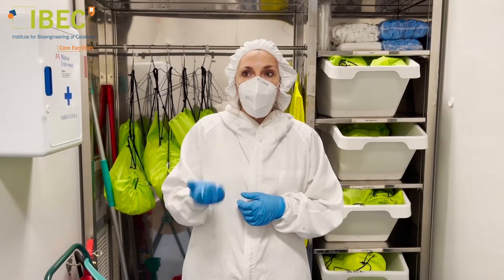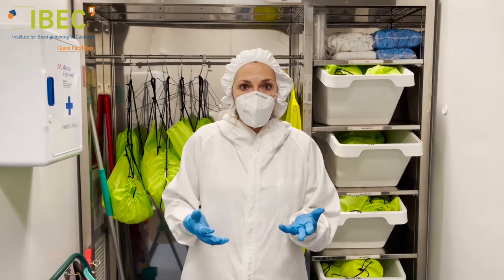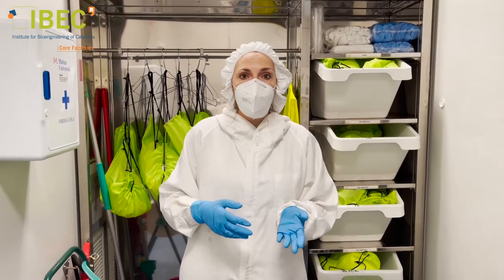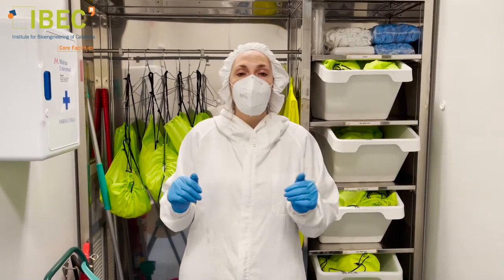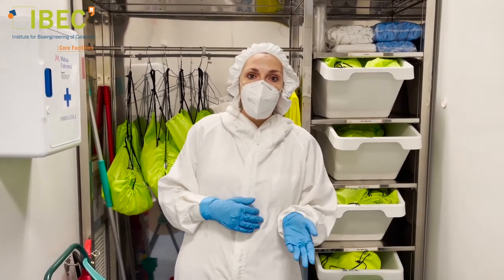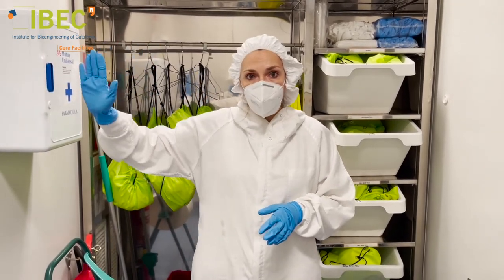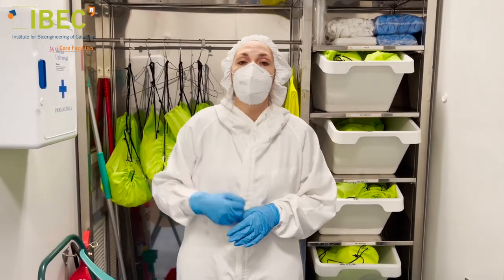Conditions such as temperature, humidity, and pressure are constantly monitored to assure uniformity of conditions during fabrication. For instance, the temperature is always kept in a range between 20 and 22 degrees Celsius, and the relative humidity is always kept between 45 and 55 percent. There is also a slight air pressure that drives all contaminants to the exit and keeps renewing the air inside the room.